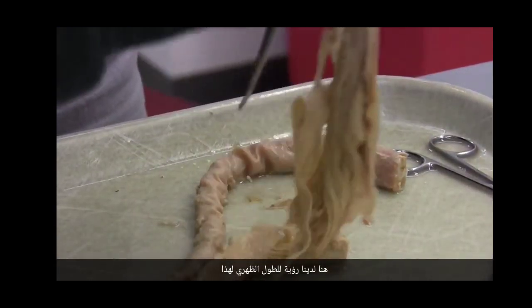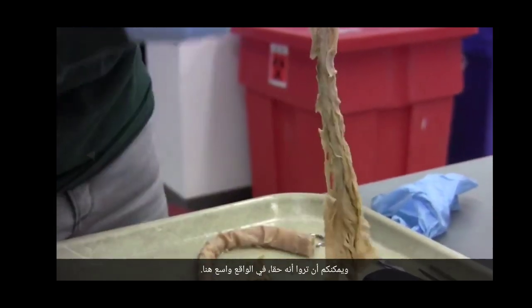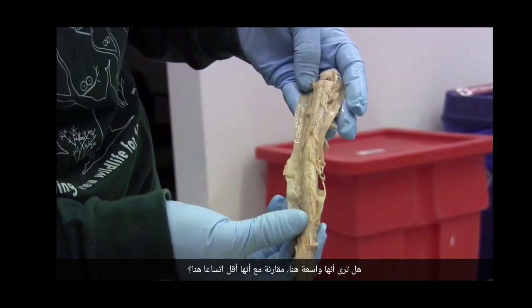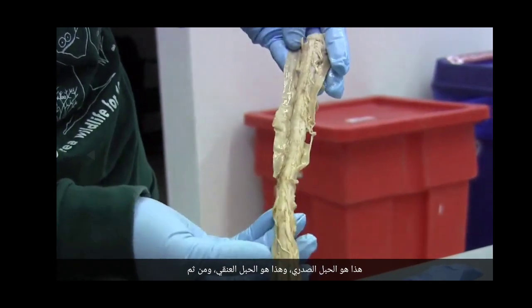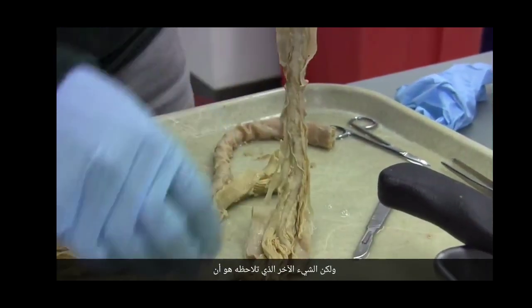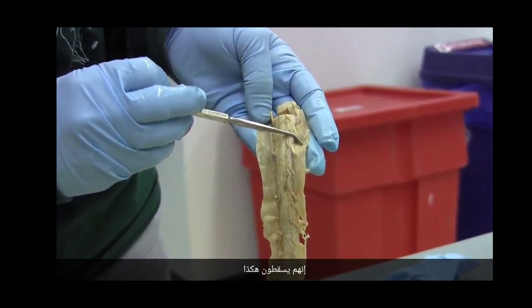So here we have a view of the dorsal length of this spinal cord, which I think comes from a cow or a sheep. And you can see that it's actually wide up here. Do you see that it's wide up here compared to less wide down here? This is thoracic cord, this is cervical cord, and then back down here it gets wider again for the lumbosacral cord. But the other thing that you notice is that these fascicles are at a shallow slope. They're going down like that. See that? Yep.